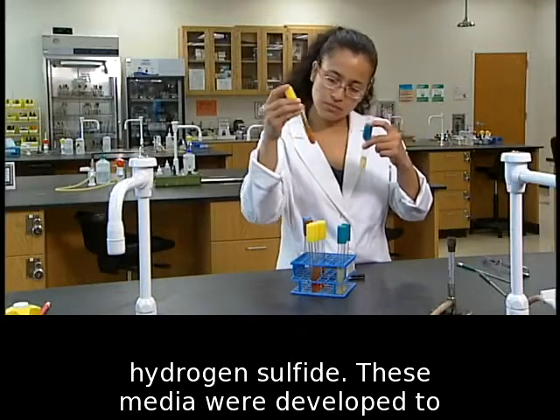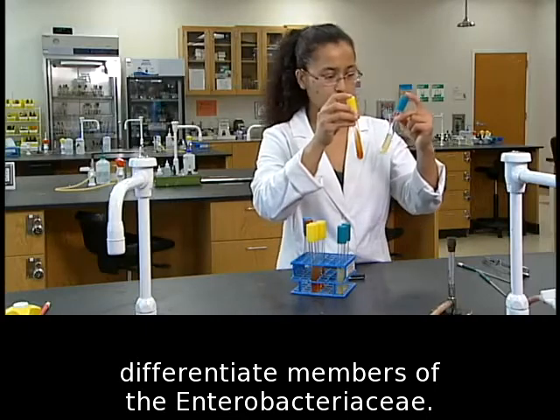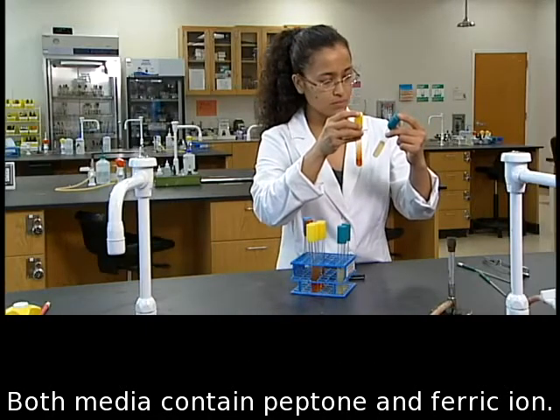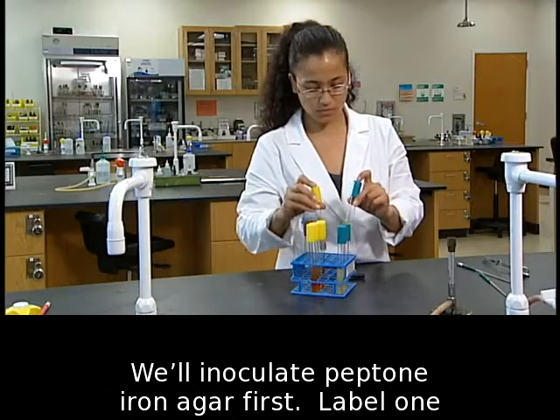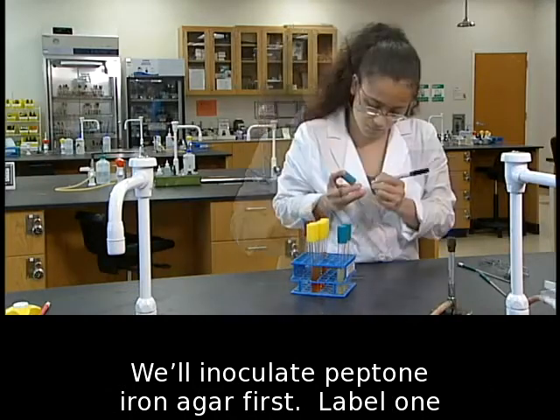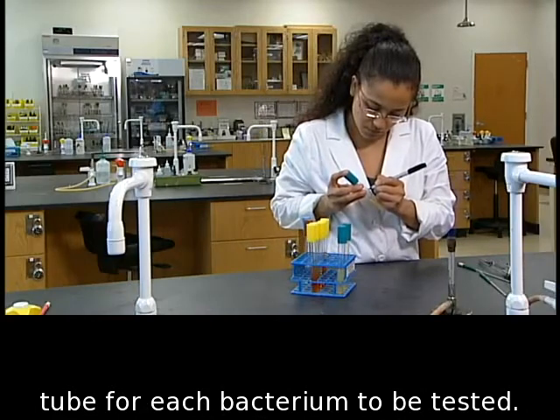These media were developed to differentiate members of the Enterobacteriaceae. Both media contain peptone and ferric ion. We'll inoculate peptone iron agar first. Label one tube for each bacterium to be tested.